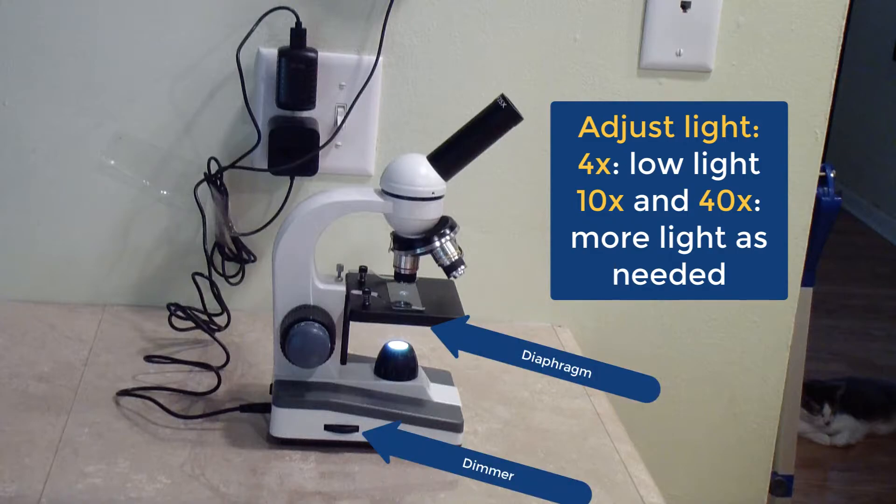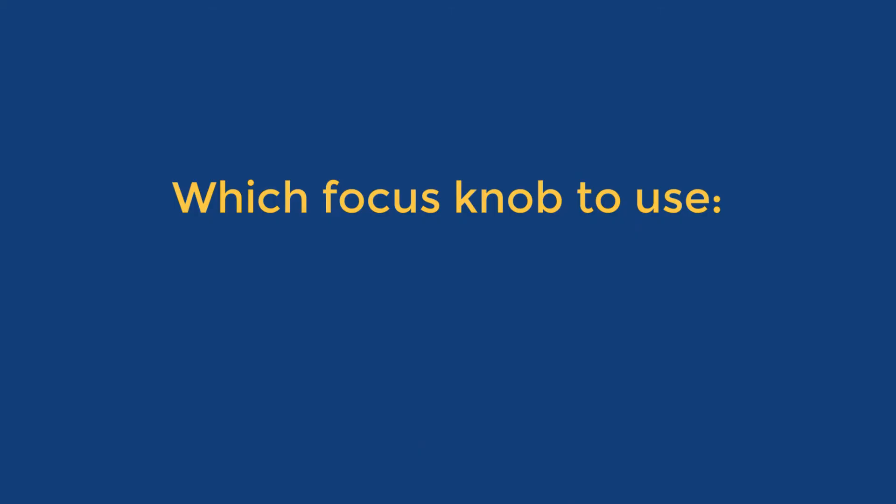You will need more light when you use the 10x and 40x objectives. Use the coarse focus knob when you have the 4x objective in place.